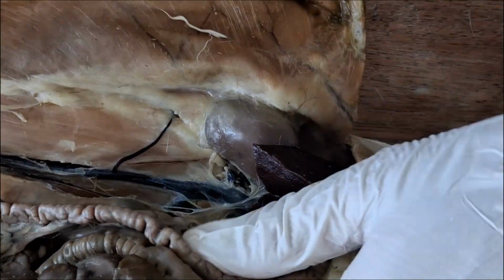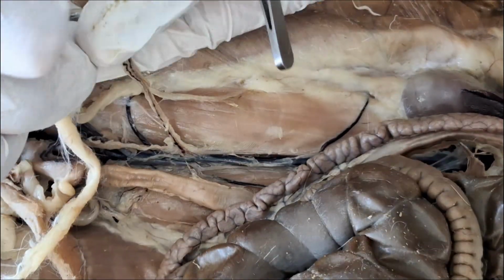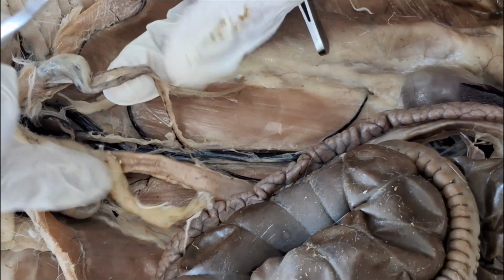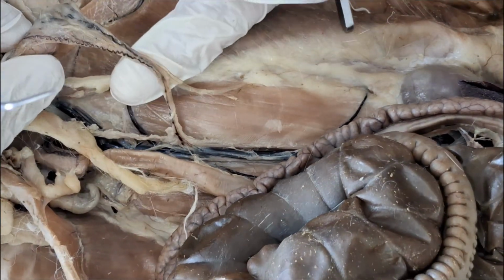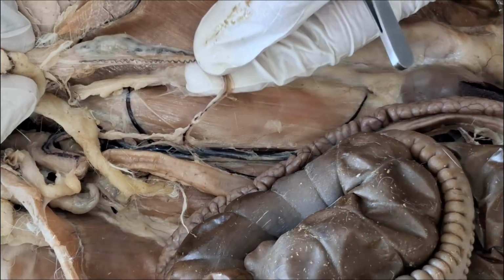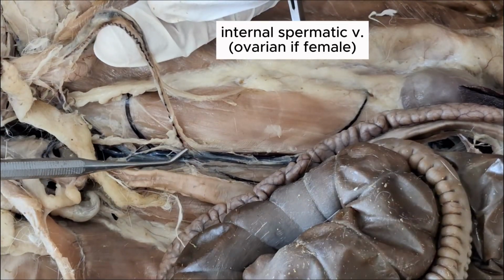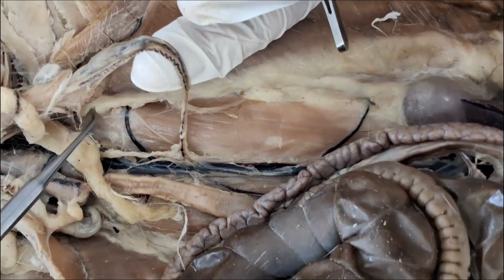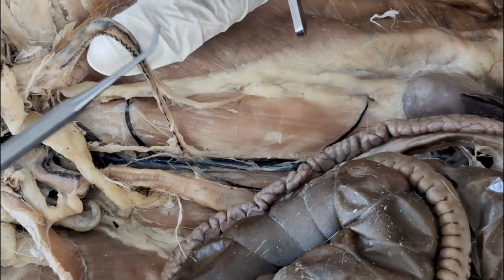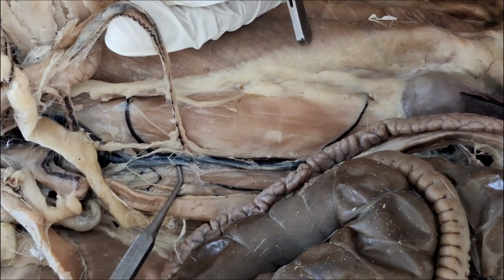Then moving caudally, look for this slender, easy to break vein that goes for the testicles. So this is the internal spermatic vein. So the internal spermatic vein drains blood from the testes, and then into the postcava, straight.